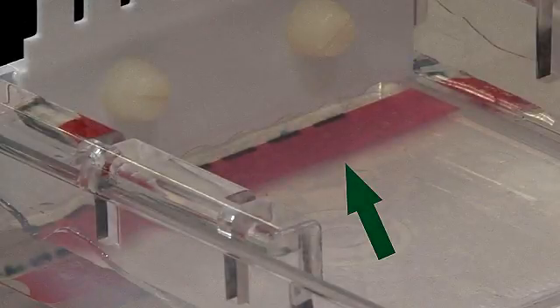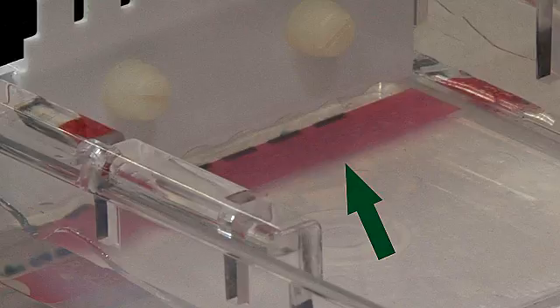The red tape on the underside of the tray or on the gel tank platform helps well detection.